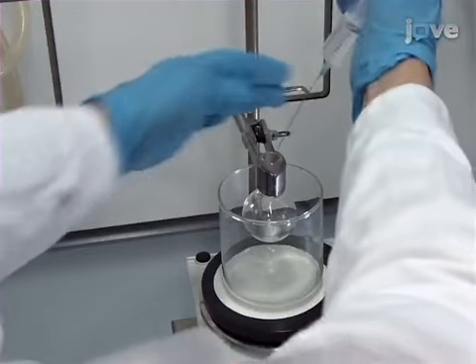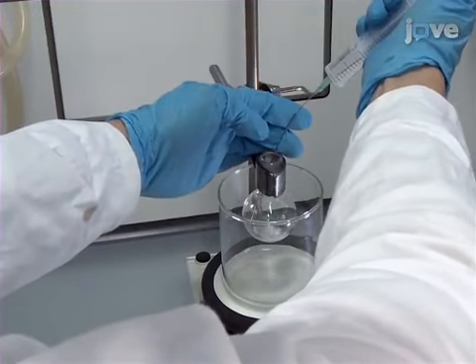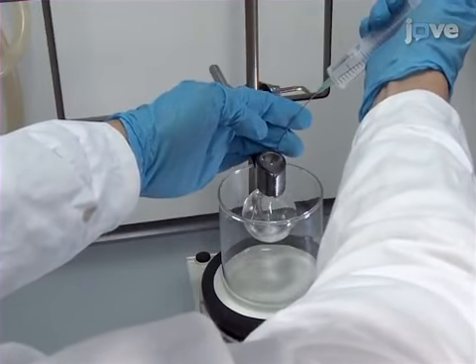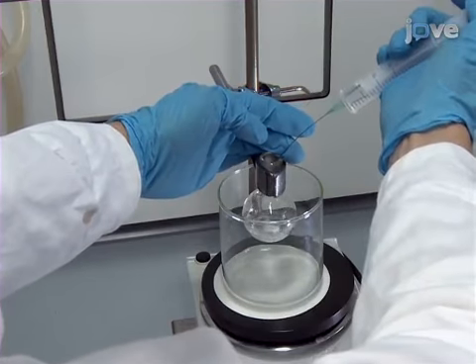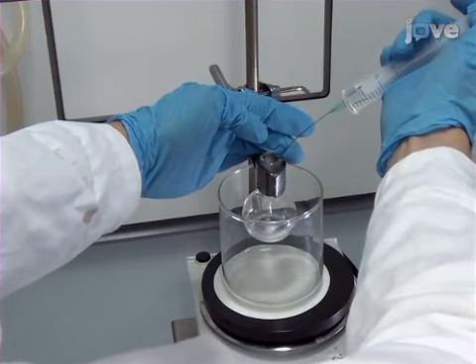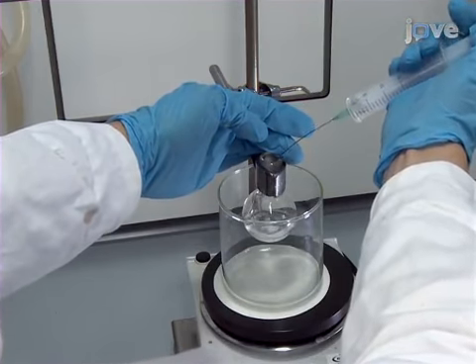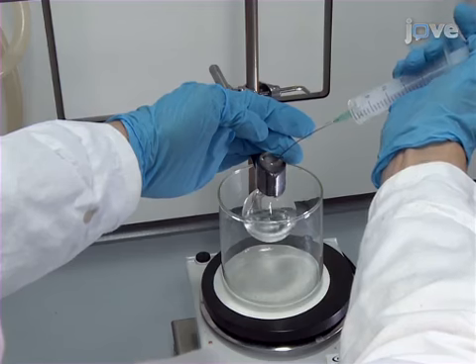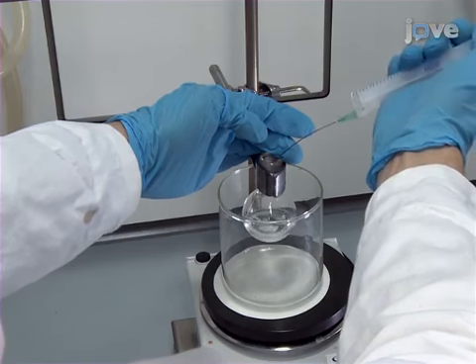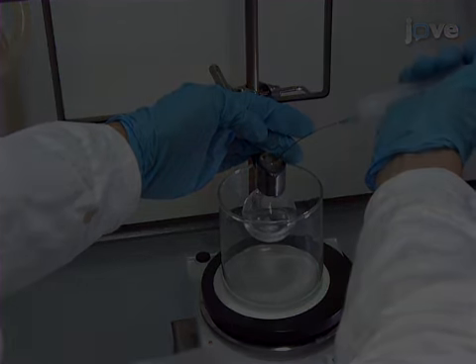First, dissolve 400mg of titanium-4-tert-butoxide in 10.0mL of dry dichloromethane in a 25mL flask with continuous stirring.